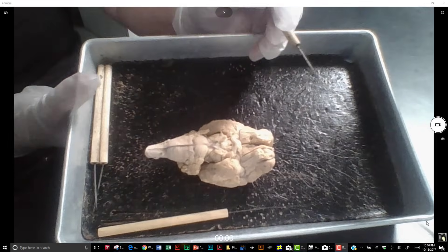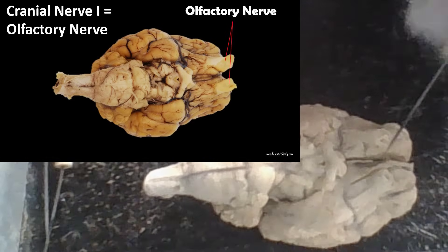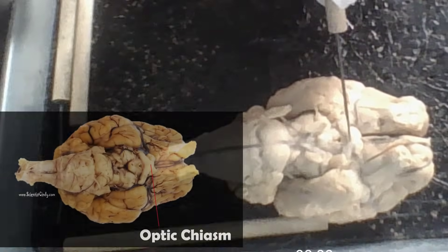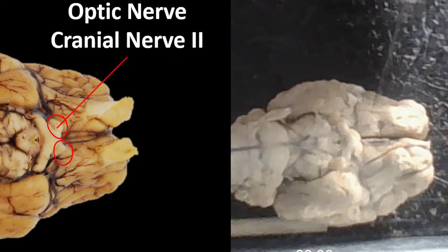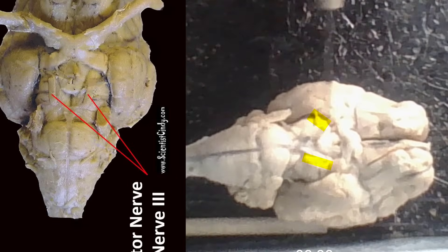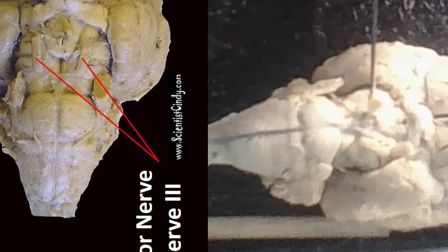Cranial nerve 1 is quite a bit larger in animals than in humans. Here in the sheep brain, this is cranial nerve 1 — the olfactory nerve — which processes our sense of smell. This structure that crosses here is the optic chiasm, and in front of the optic chiasm we have cranial nerve 2, the optic nerve. Behind cranial nerve 2 we have cranial nerve 3 — one here, one here, one here — and this is the oculomotor nerve.